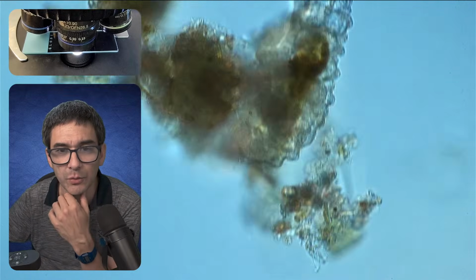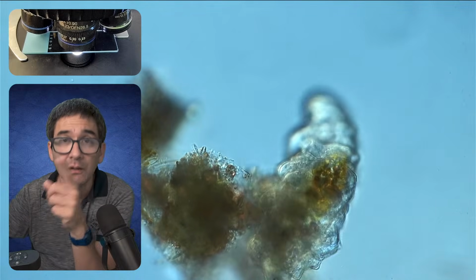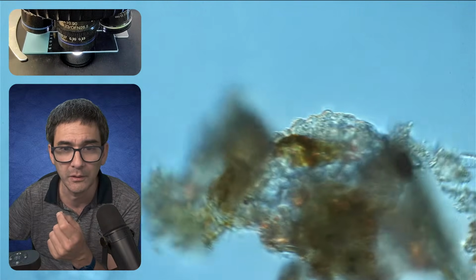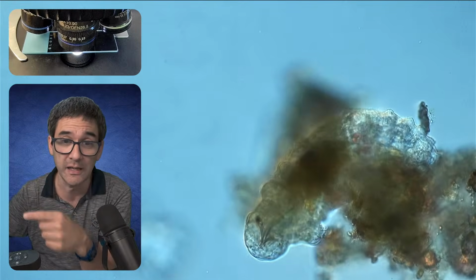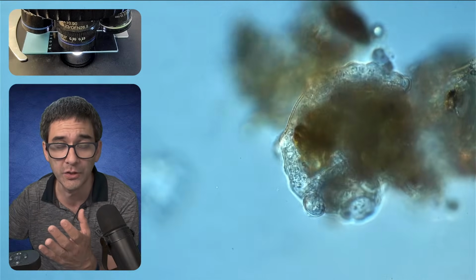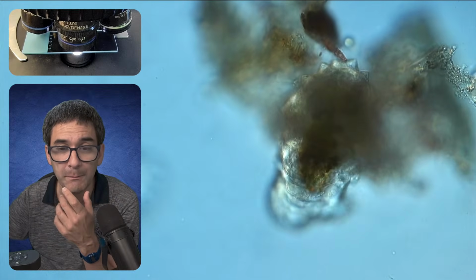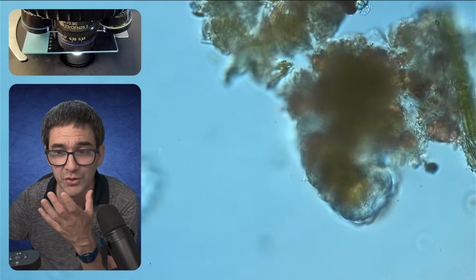But there are many things in nature that move. But the reason why we consider this alive, and not, let's say, an engine spinning and rotating, is because the movement is to a certain extent unpredictable, and it appears to be a little bit random. A spinning engine, we know it's not alive because it's always a repetitive motion, right? So it can't be alive. But if we look at a tardigrade like this over here, I don't know into which direction it's going to move in the next minute. I cannot predict it. And I think that this unpredictability also hints a little bit towards living systems.